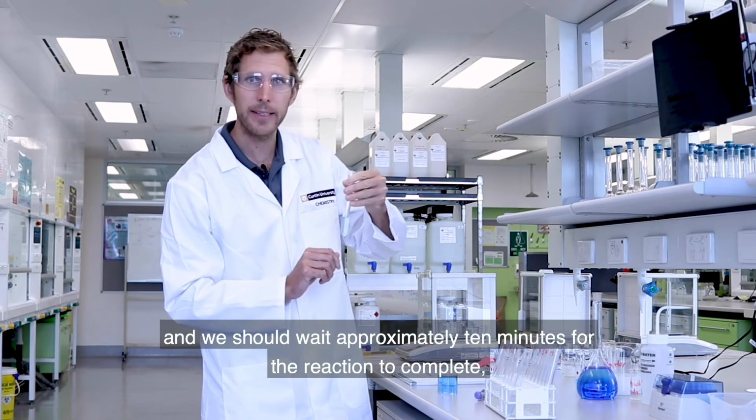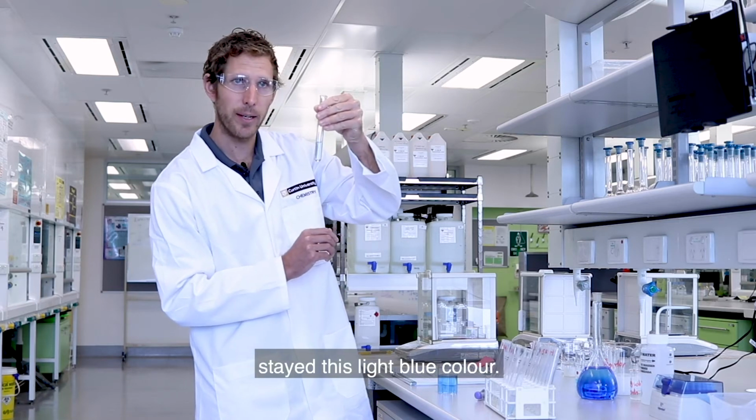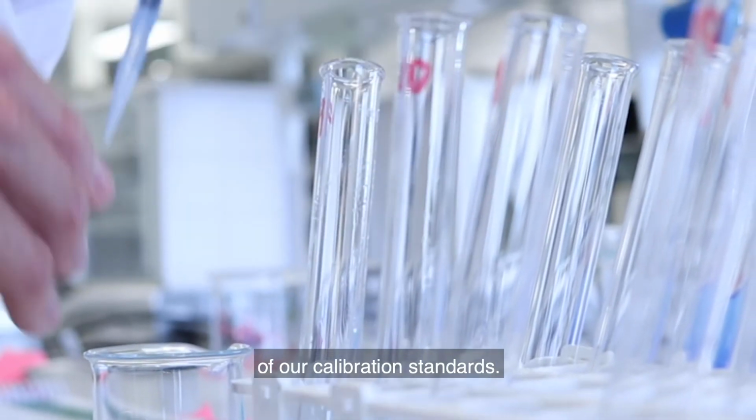Now we should wait approximately 10 minutes for the reaction to complete, but hopefully you can see that stayed this light blue colour. So while that waits for 10 minutes for the reaction to complete, we'll do the rest of our calibration standards.